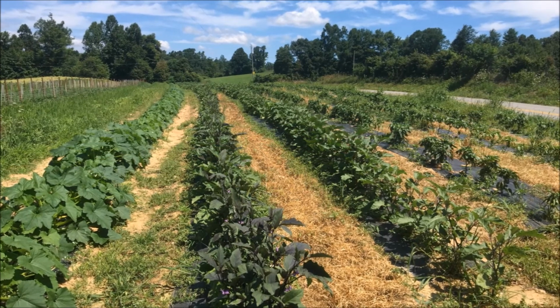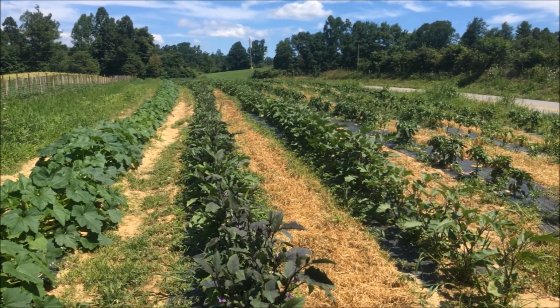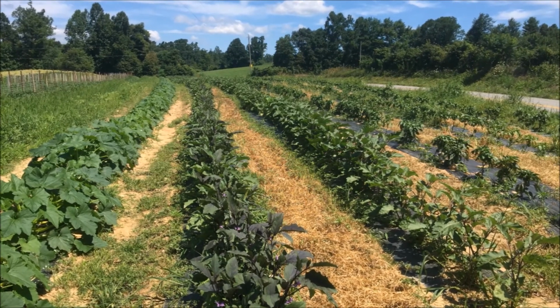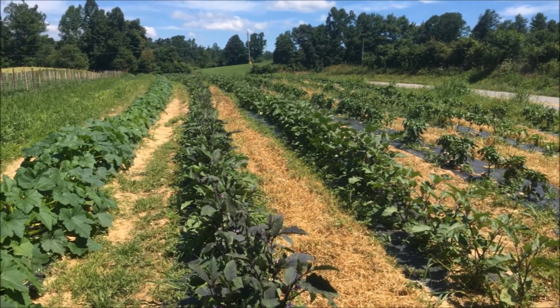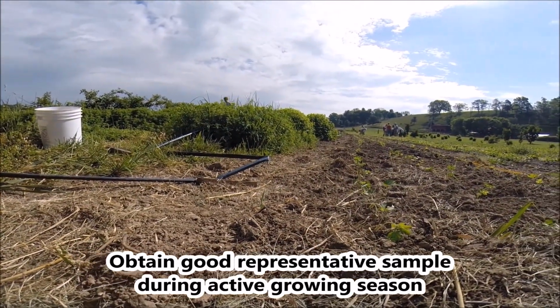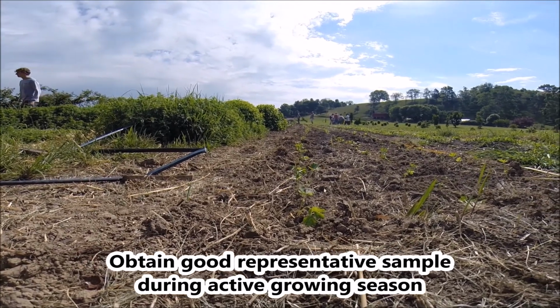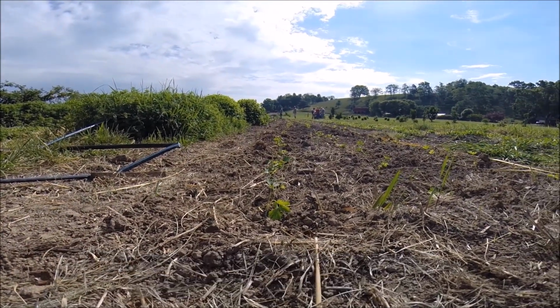Because collecting samples of groundwater and surface water is slightly different, we will highlight specific collection tips for each of these types of sources. The goal in both cases is to get a good representative sample of the water source, collecting during the active growing season when agricultural water is used for various production activities.